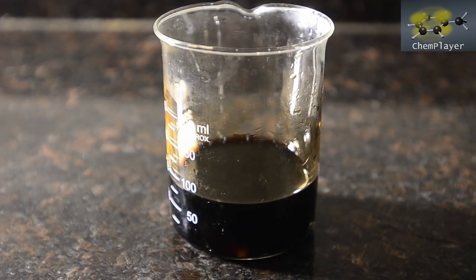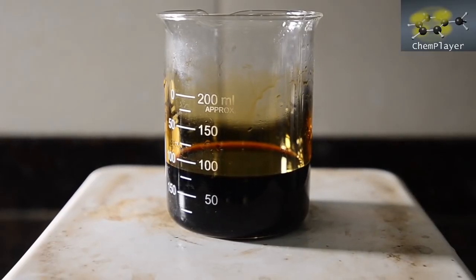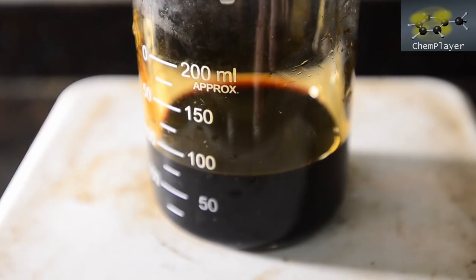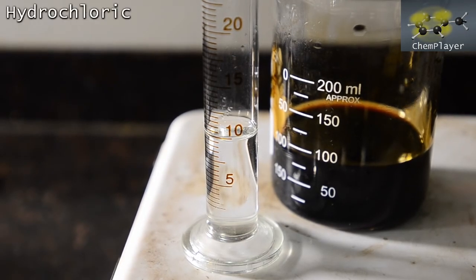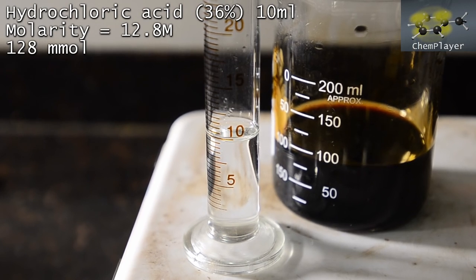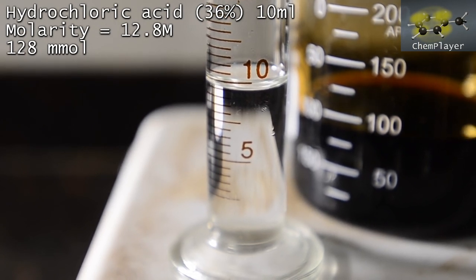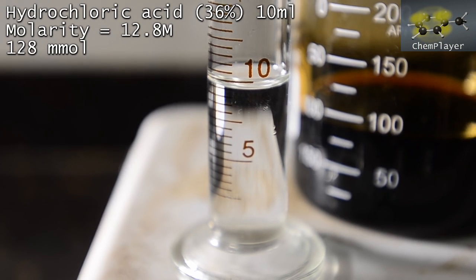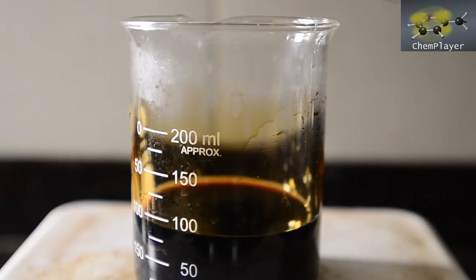Well, in order to get our hydrolysis product out, we're now going to need to neutralize the excess sodium hydroxide and convert the sodium phenolate salt back into the free phenol again. So let's get our filtrate onto a stirrer and get it stirring well. And here we've got 10 ml of concentrated hydrochloric acid, which should be more than enough to bring the solution to neutral. We'll need to be careful not to over-acidify, otherwise the amine group in the aminophenol will form a water-soluble hydrochloride salt. So we'll need to check the pH carefully as we add the acid until we get to neutral. Let's get a bit in and start neutralization.